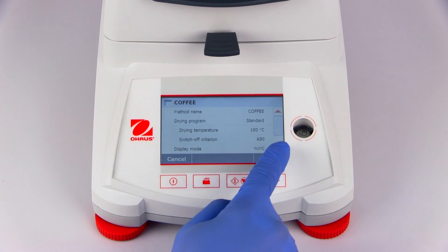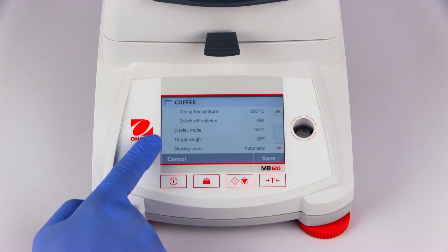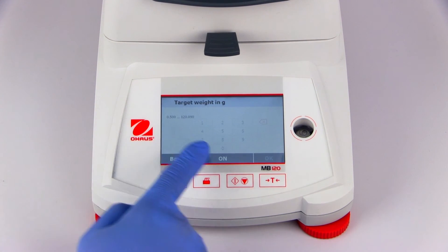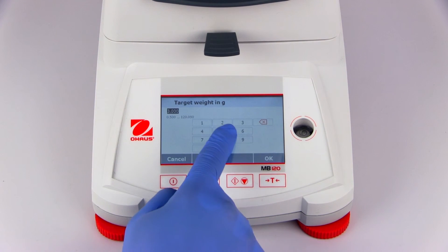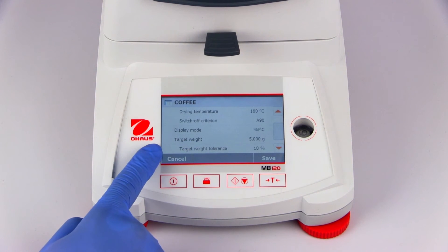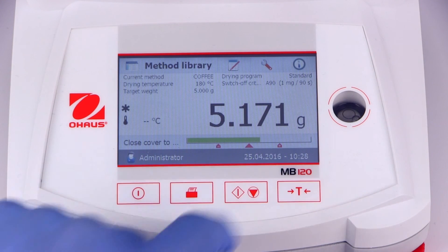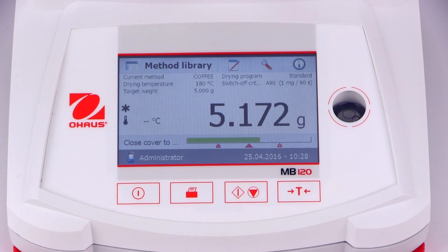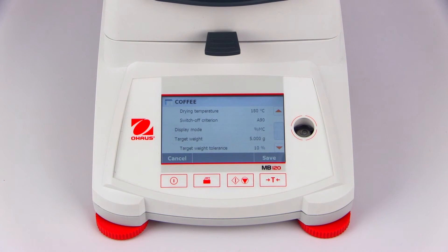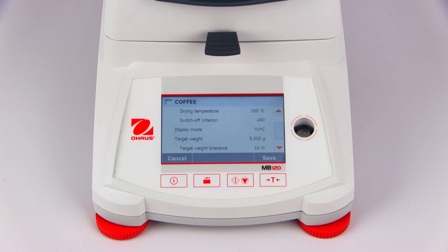If desired, a target weight can be set. If set, the device will ask the user to define a target weight and a tolerance. Once enabled, a graph will be shown during the initial sample weigh-in process, aiding the user in dispensing the correct amount of sample. The measurement cannot be started unless an initial sample weight is within the specified tolerances.